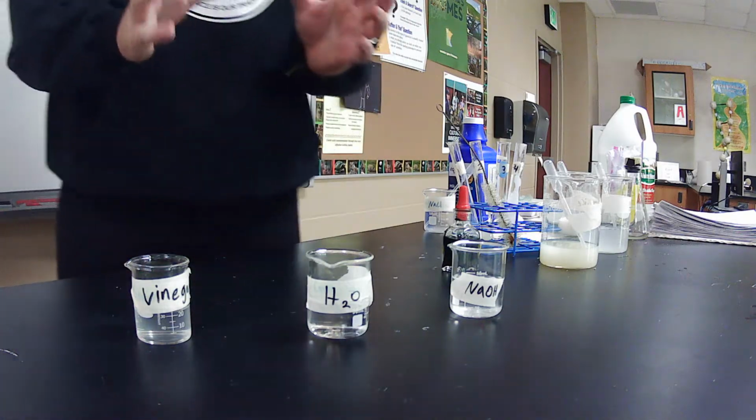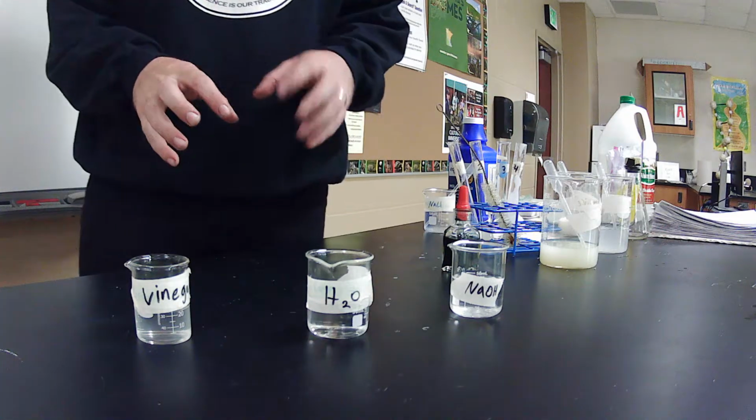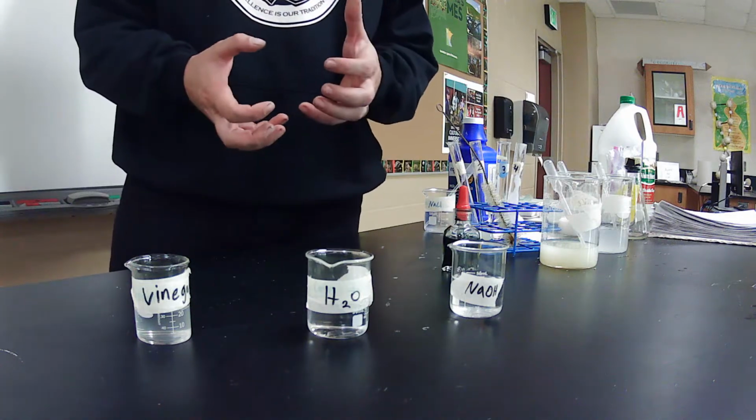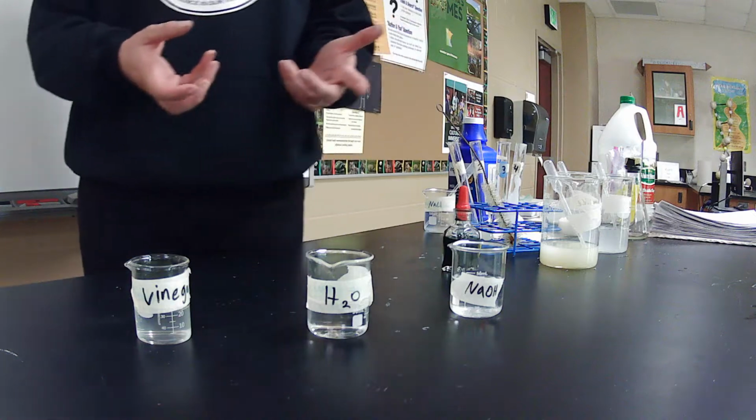So today in class, guys, they have done a lab where they were testing different pH levels, testing if something is going to be acidic, basic, or neutral. Today, I'm just going to run through that lab with you so you guys can at least see it, so when we refer back to it, you have some type of idea.